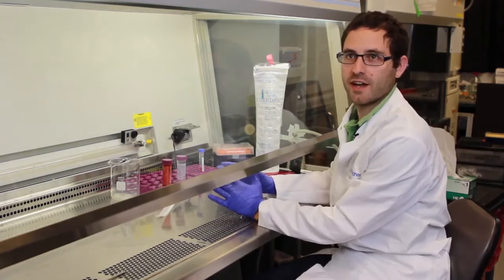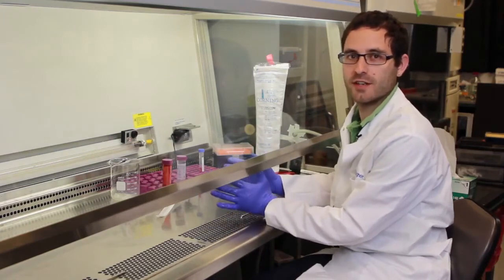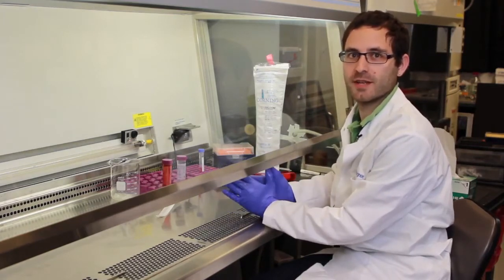Okay, now that everything is sprayed down, it's inside the hood and we're ready to bring our cells into the hood and start splitting them.